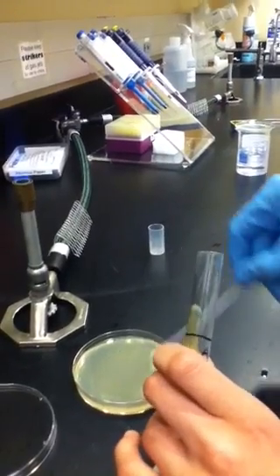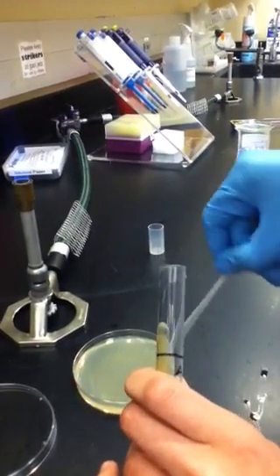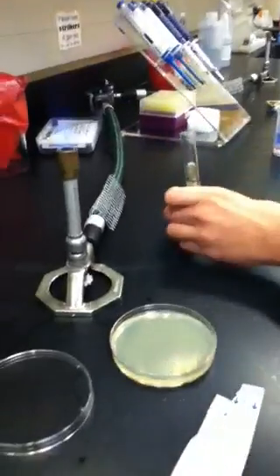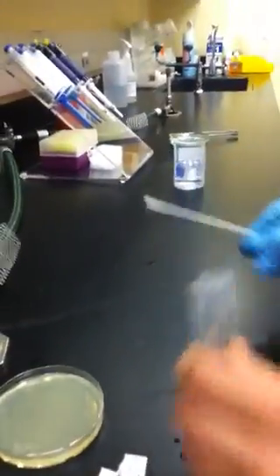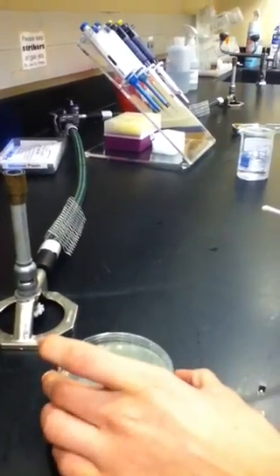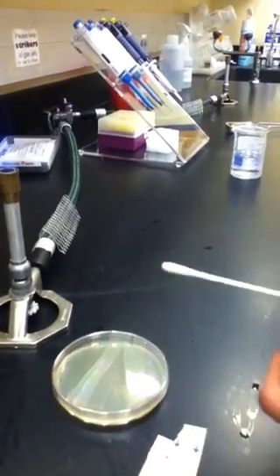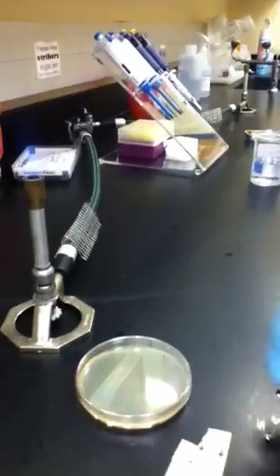This is probably not the best thing to smell or drink or anything. Now we're going to take antibiotic discs and place them on this plate and see what sort of radius — how well they kill bacteria.